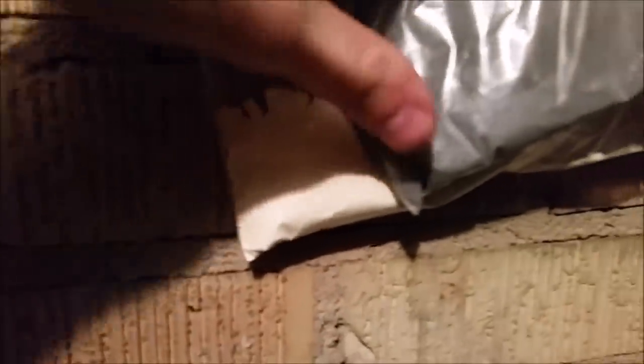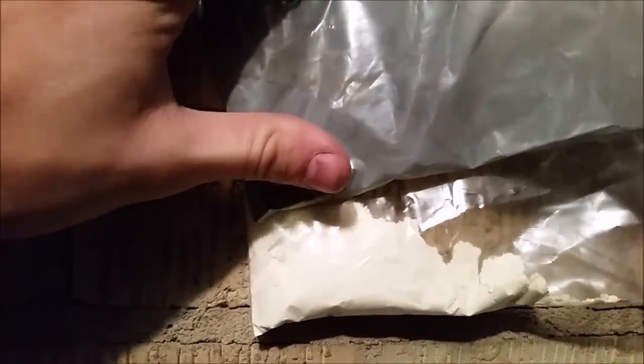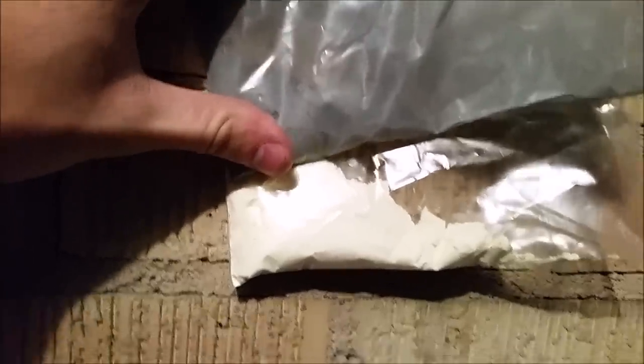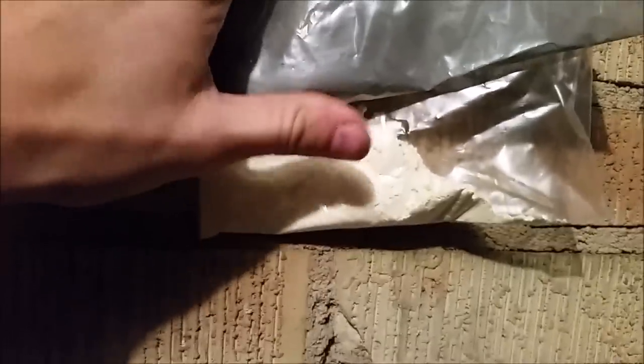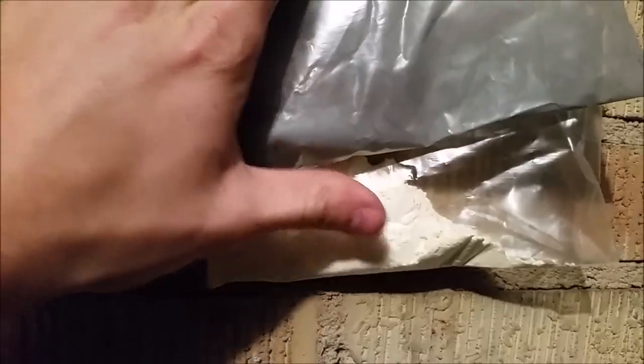This means I've got to sweep the entire floor. But before I do that, I'm going to do one optional thing that will definitely improve cleanup: sulfur powder and zinc dust. Both are commonly found in mercury cleanup kits. The zinc will adhere to the mercury, alloy with it, and turn it from a liquid into a solid amalgam, which means it won't evaporate. The sulfur reacts with mercury vapor to form mercury sulfide, trapping the vapor and eventually consuming the entire mercury droplet into a non-harmful form. I'm going to sprinkle a little bit of this onto the floor.